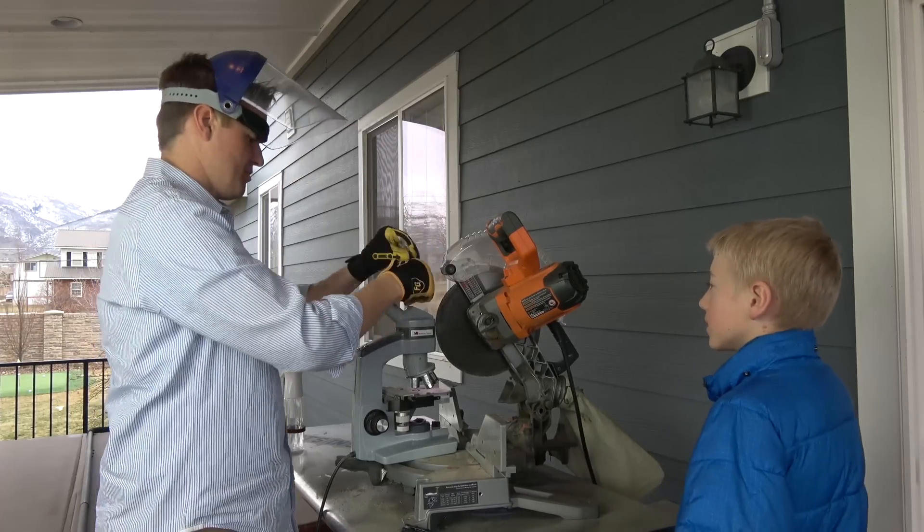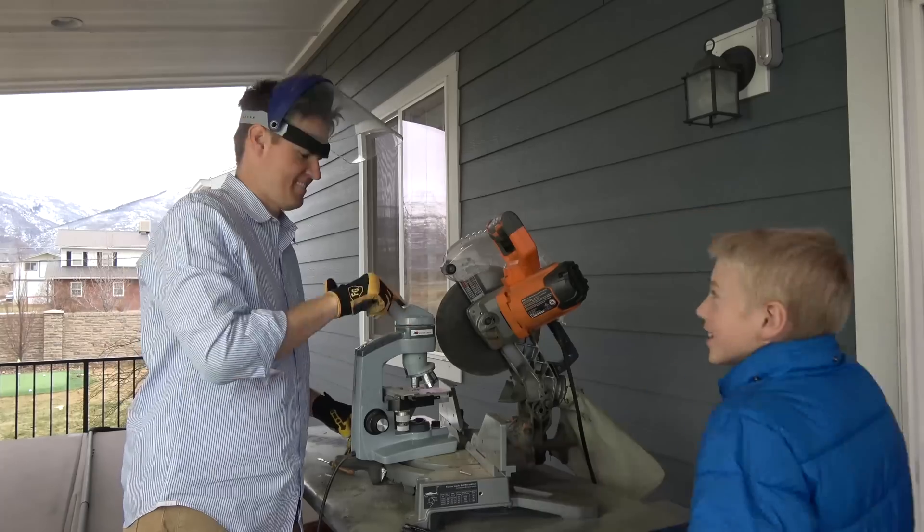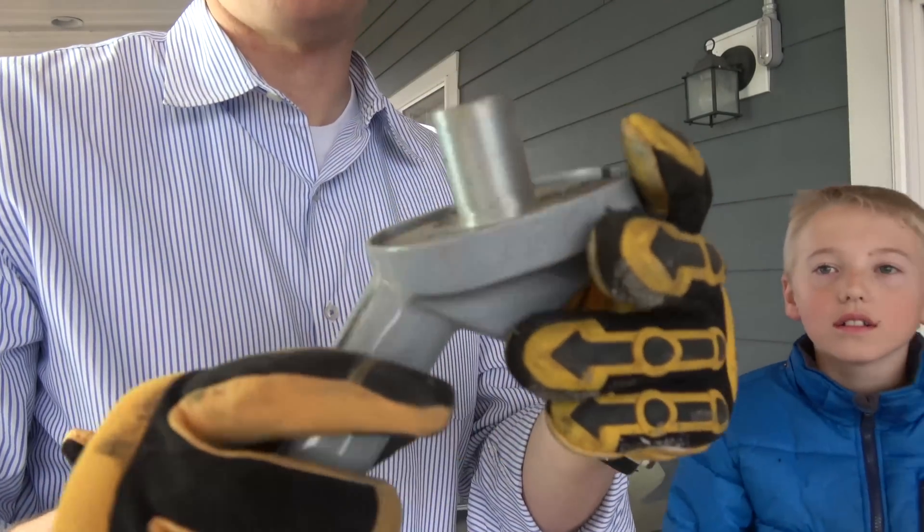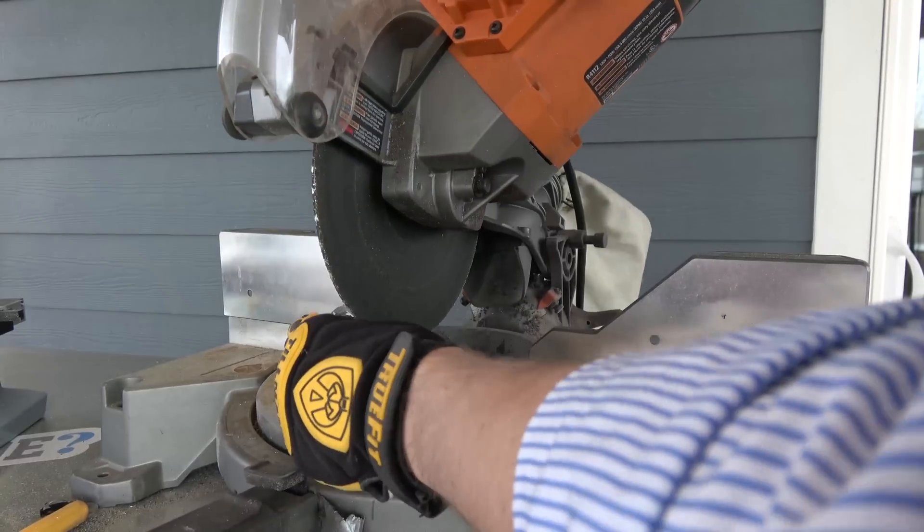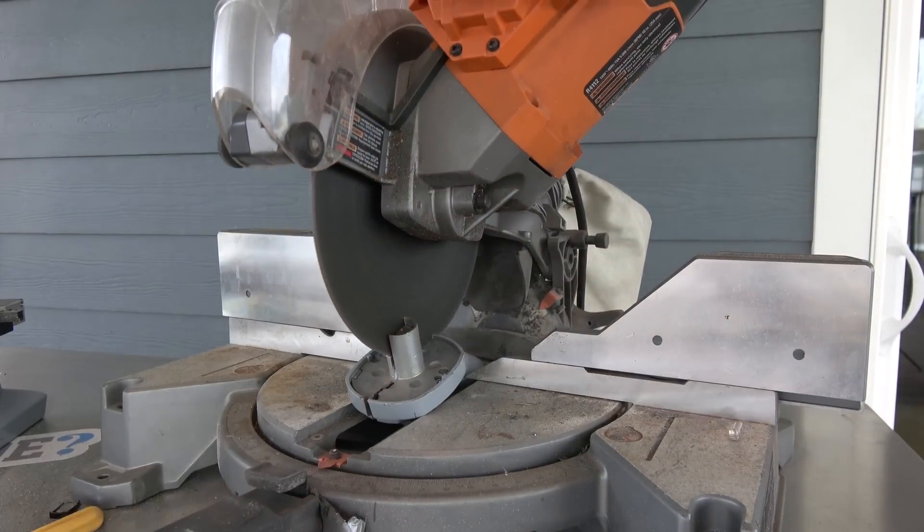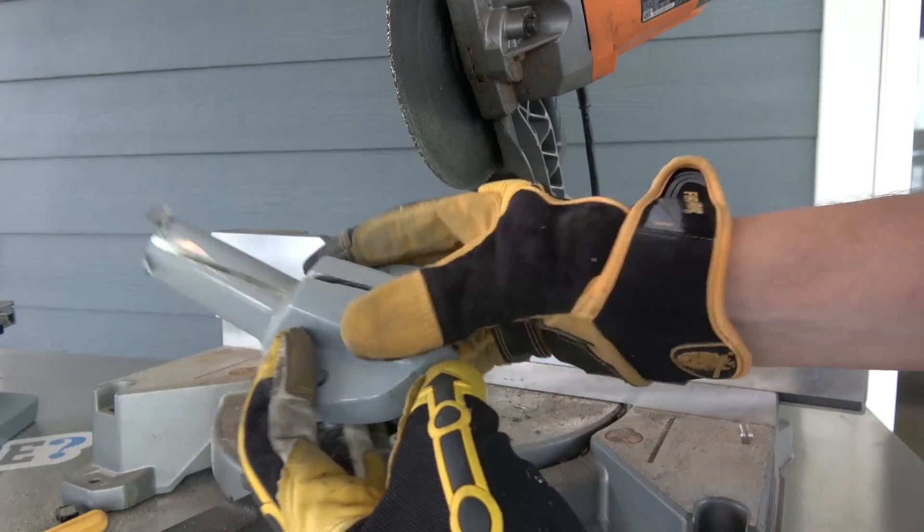Go, go, go. Count along with Lincoln, everybody. One, two. It's off. We still need to get into this. Look, there's lenses right there in it. Just hanging on by a thread.